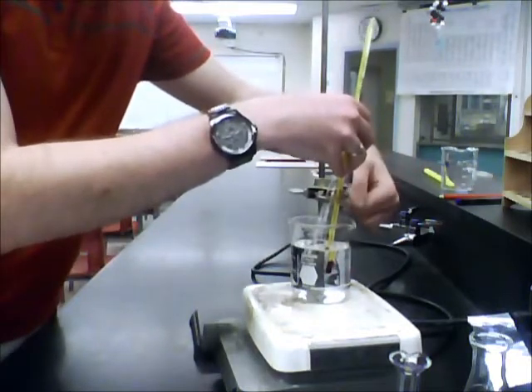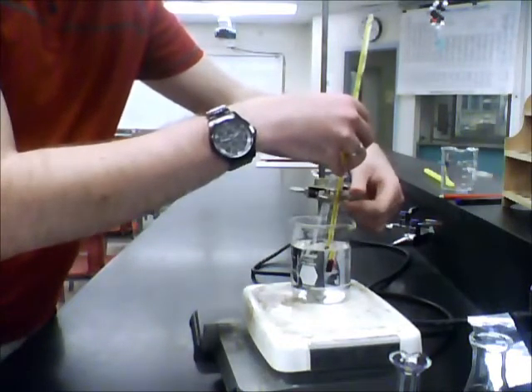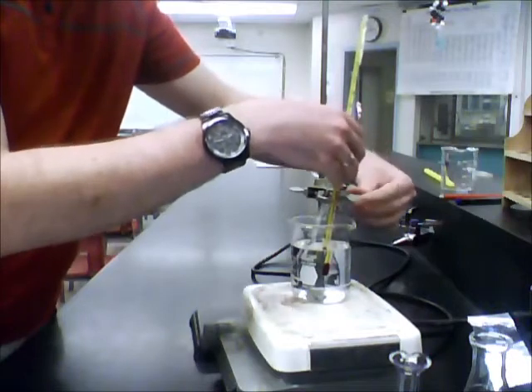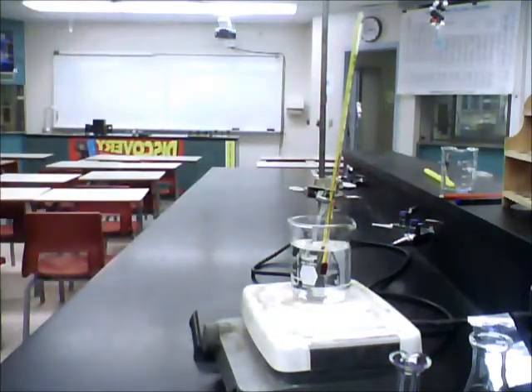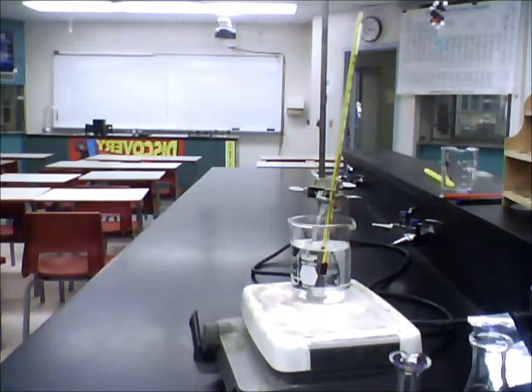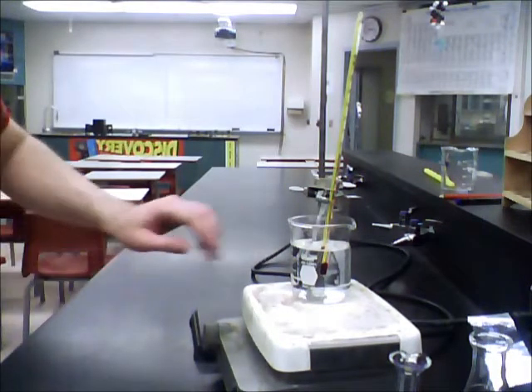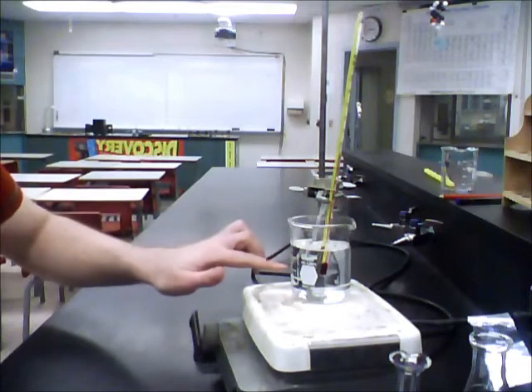Once again, you're just using the test tube clamp to secure it, but not too tight because you don't want to have the glass break. At this point, I have a test tube resting about halfway through the water.